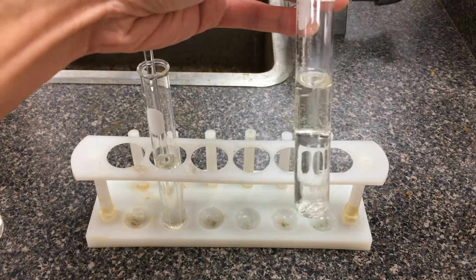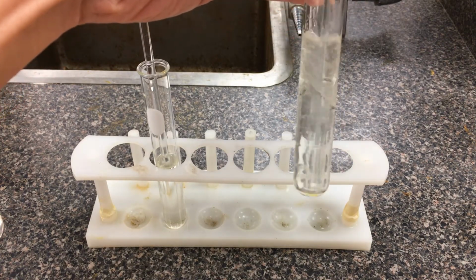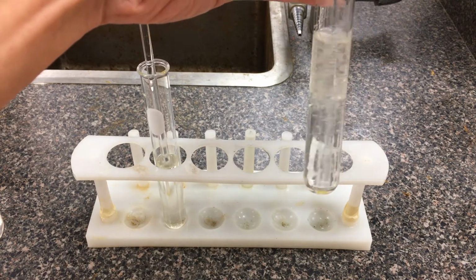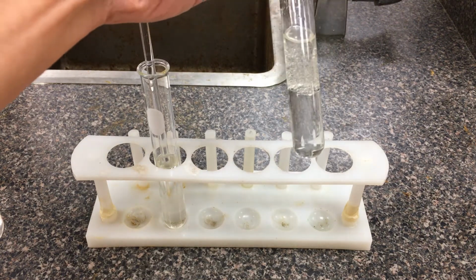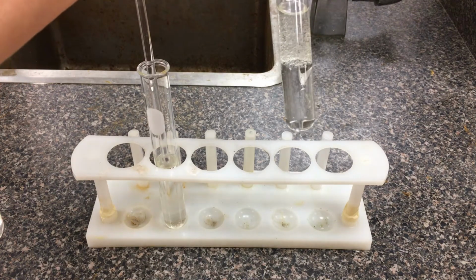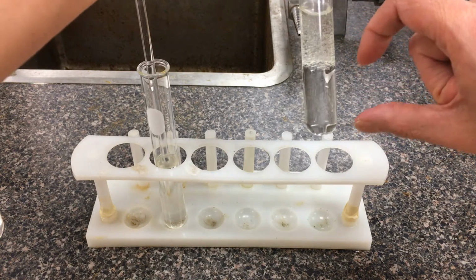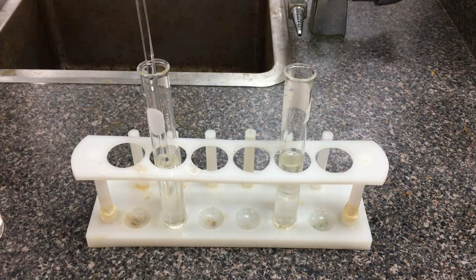Sure, temporarily with the stir rod here, I might be able to suspend it. I may be able to push the oil into the polar parts of the water, okay? But eventually they will end up separating, which is something that I really rely on for the separation technique, solvent extraction. Depending on the density of the oil, sometimes the oil layer is on top, sometimes the oil layer is on the bottom, but definitely this is separated into two different layers. All right. Thanks, guys.